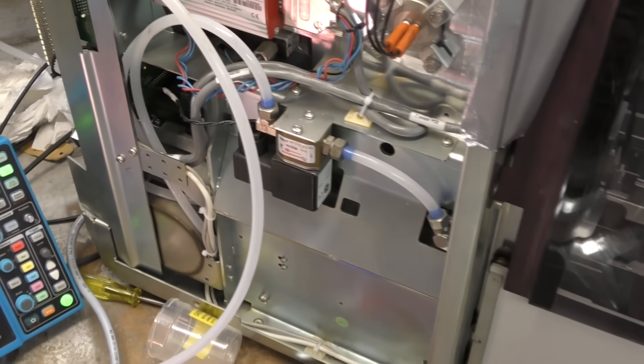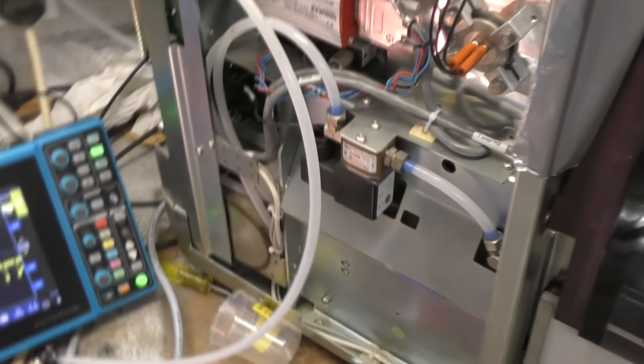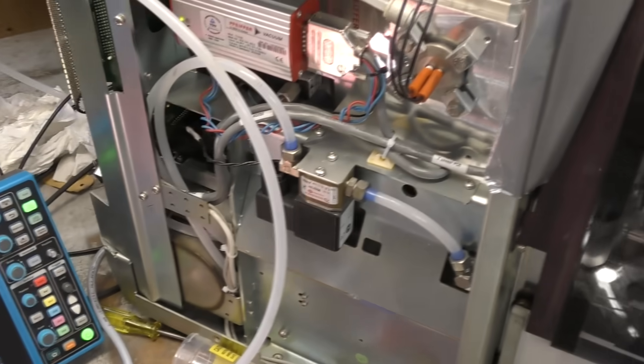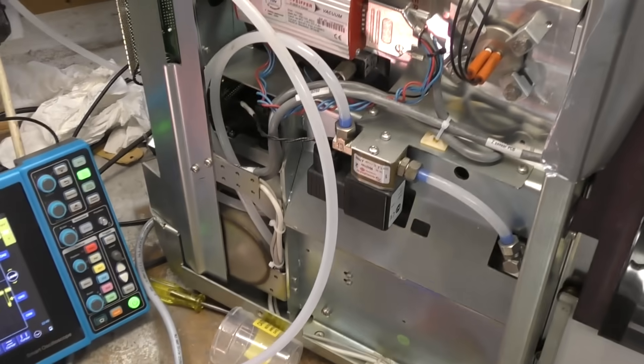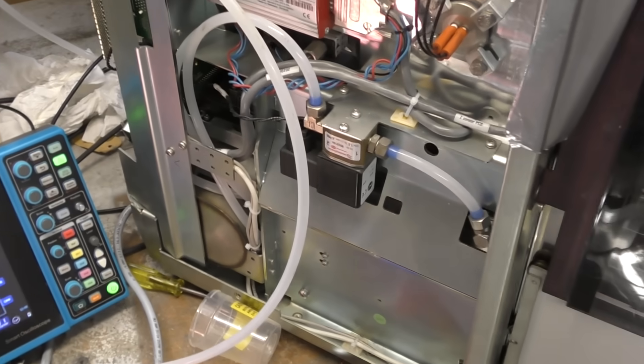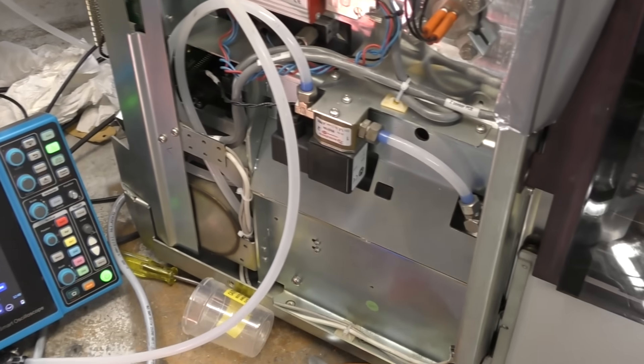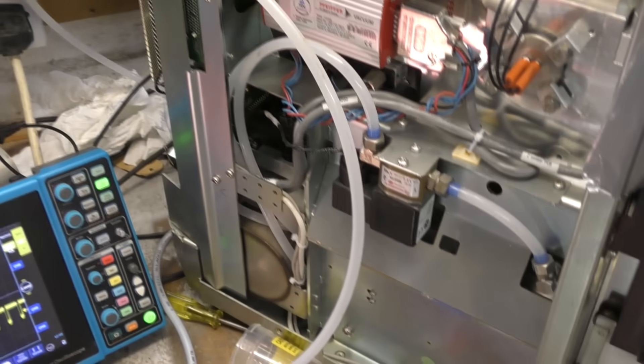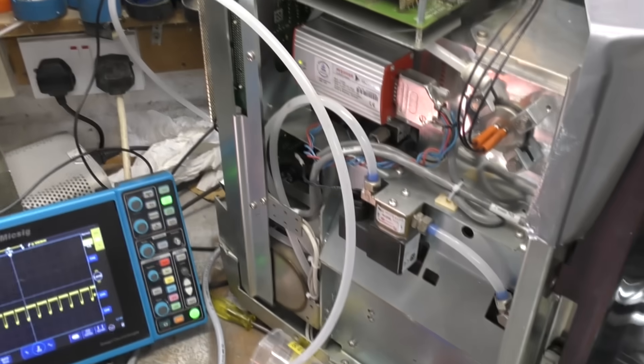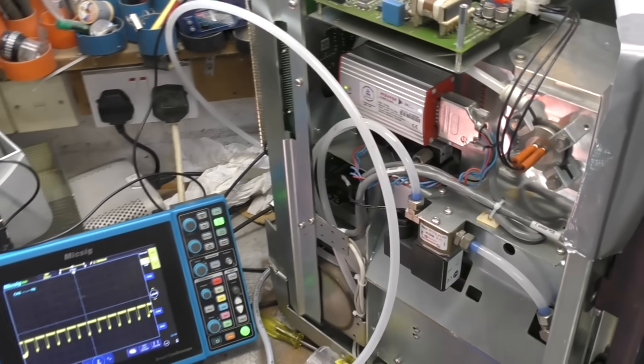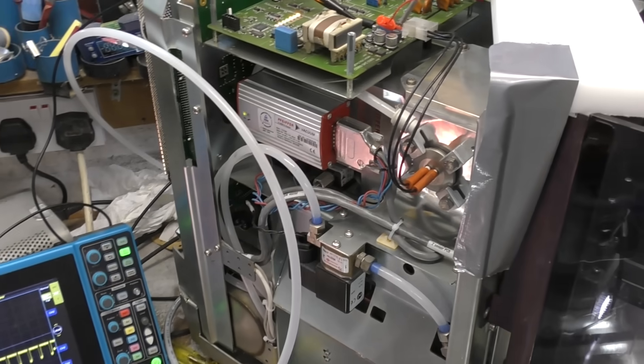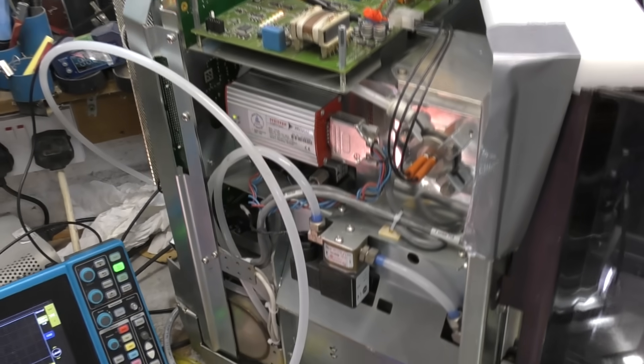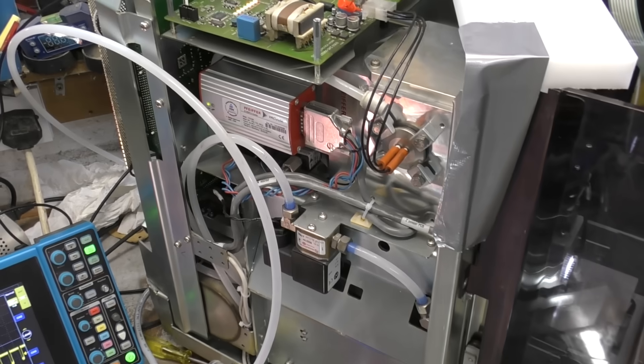Obviously it won't be nearly as good as it's capable of, but worst case, hopefully we'll actually get something going. And if anyone happens to have a cerium hexaboride crystal emitter kicking around gathering dust, then please get in touch.